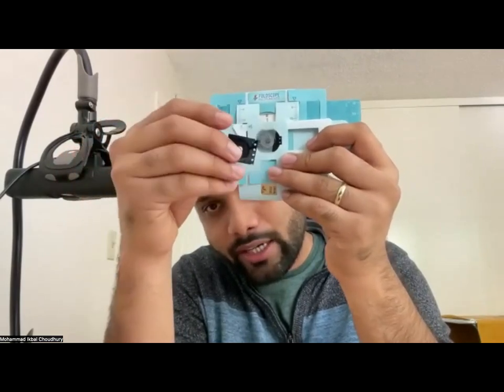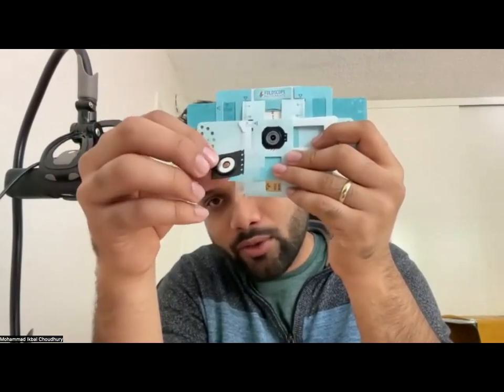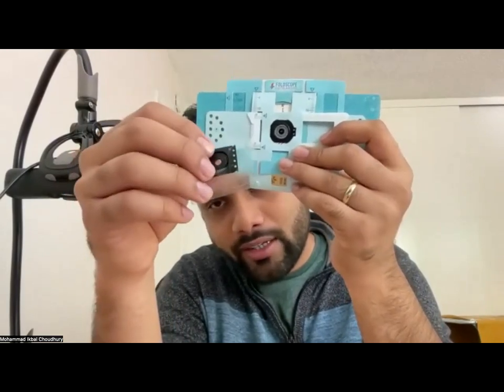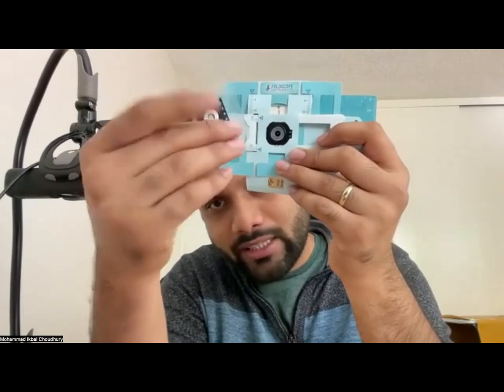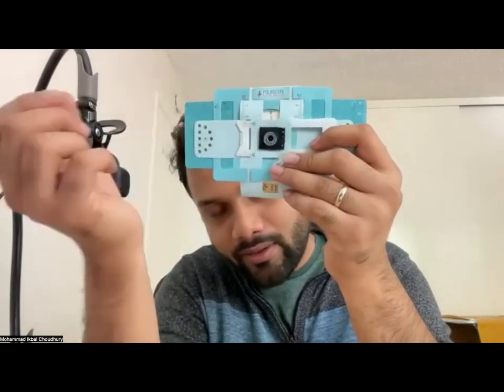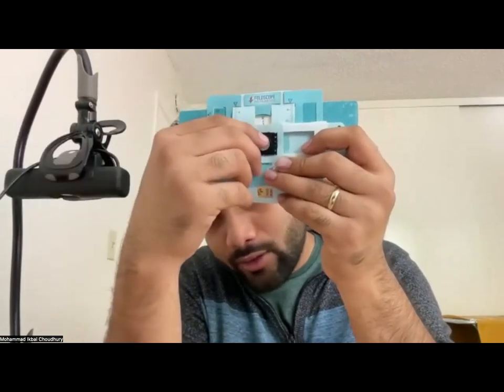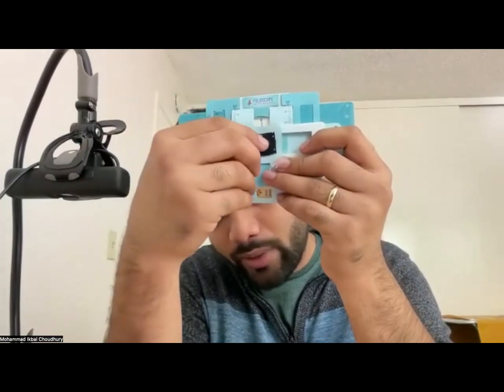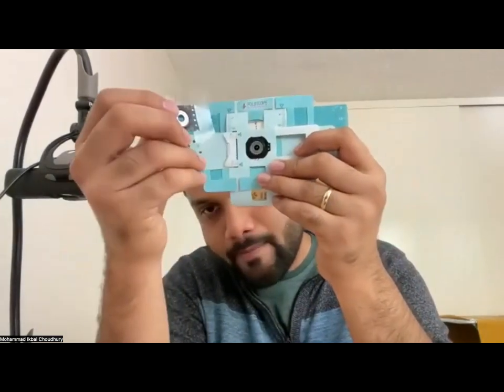Yes. So when you connect this, it also has a tiny groove there, and that basically fits the groove here. Okay, so it snaps. So there is no alignment problem here. It just snaps whenever you place it closer to the eyepiece.